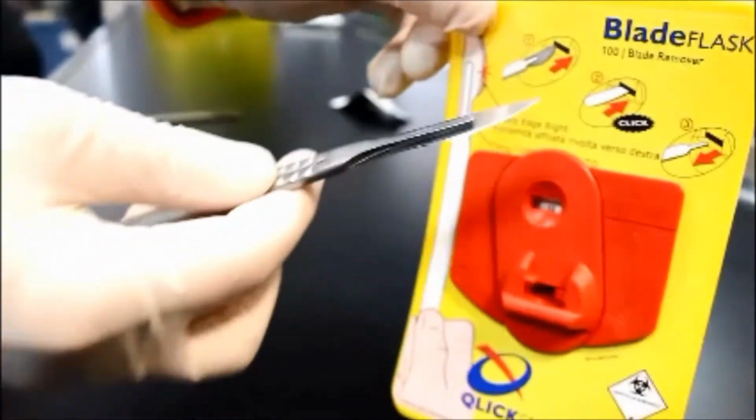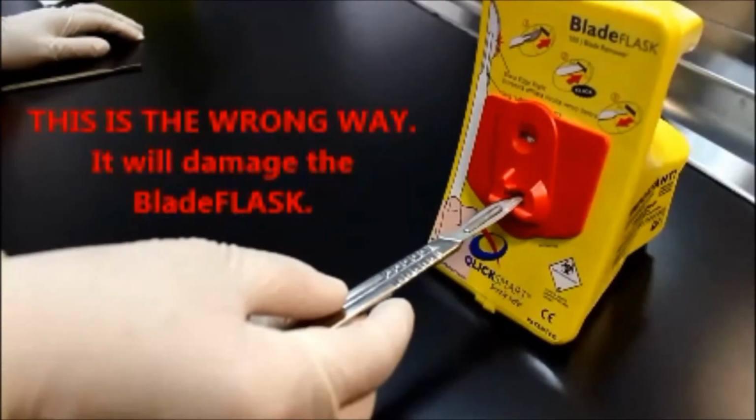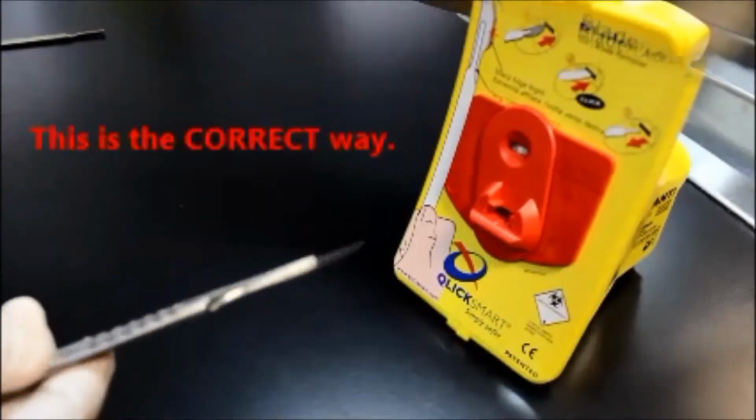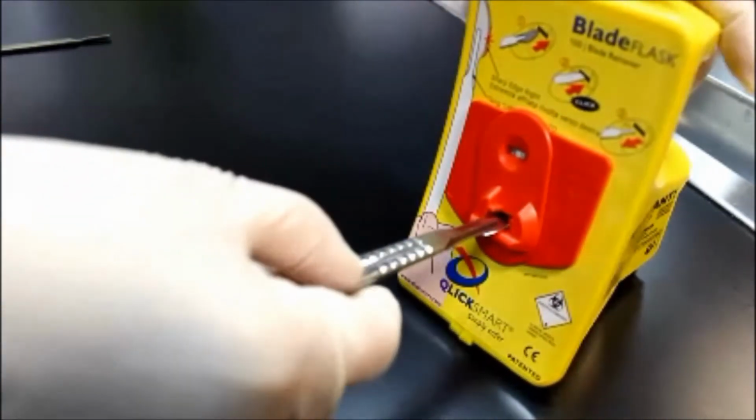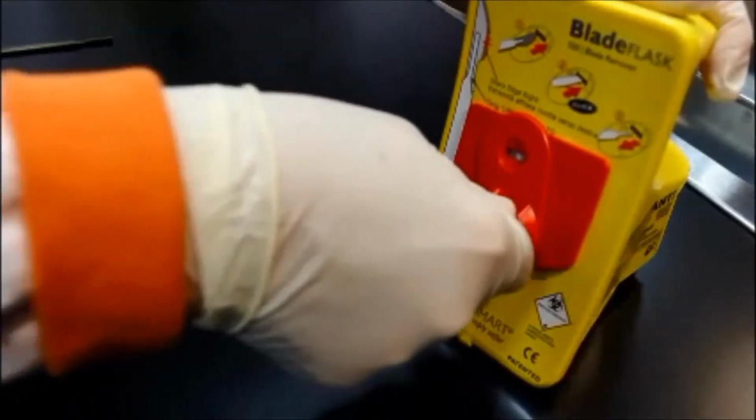Ensure that the blade is pointing to your right, as indicated by the diagram on the container. Then slowly but firmly insert the blade into the container until it will go no further. You should hear a click. Then pull the scalpel handle back out of the container and the blade will remain inside.